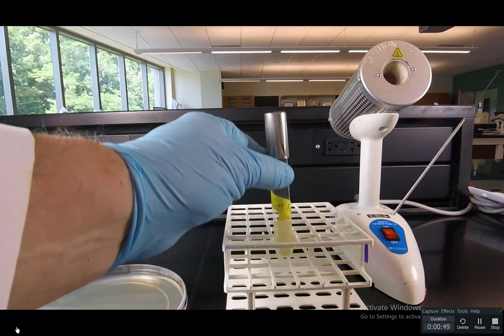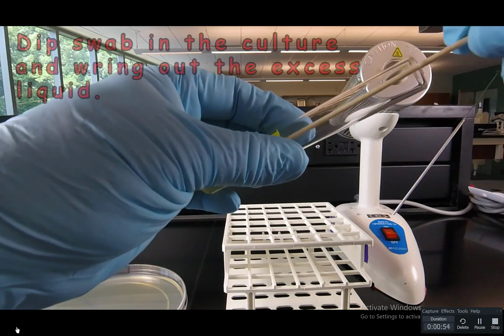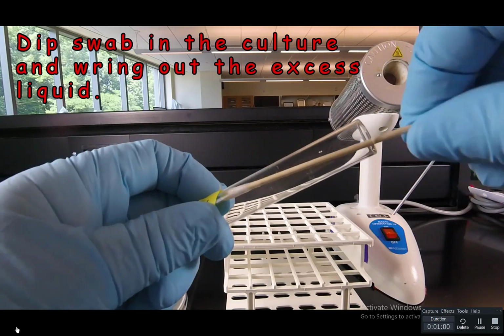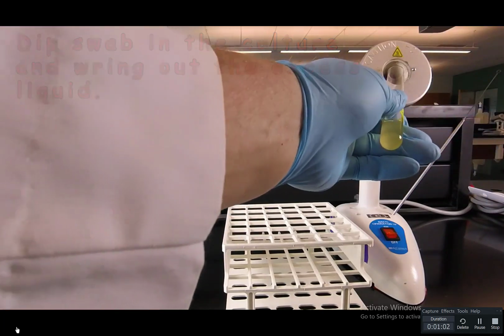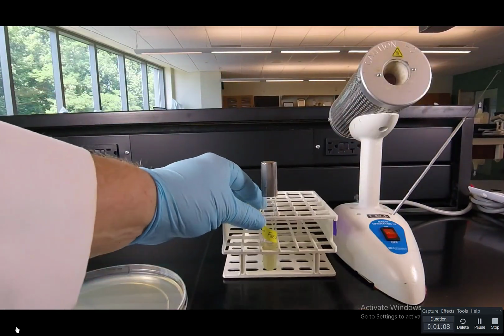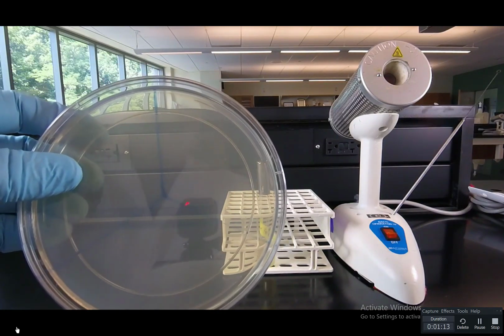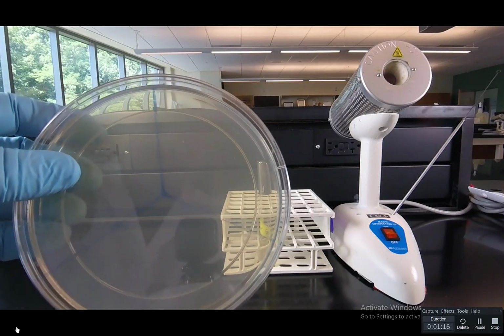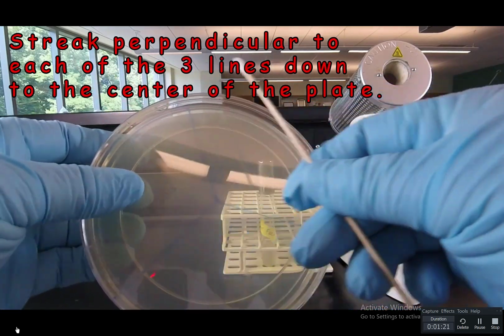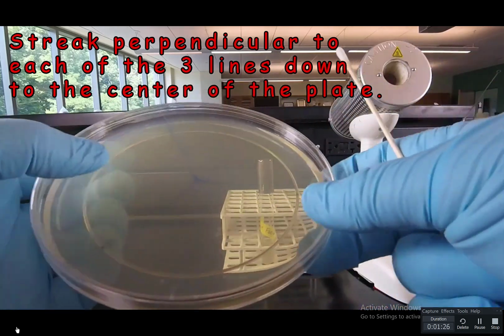We're going to remove the inoculum by flaming the tube, putting a swab in. Then we're going to wring the swab out against the inside of the tube to get rid of excess liquid. Flame the tube and replace the cap. Now we're ready to streak the plate. Now we divided our plates into thirds, as you'll see in the illustration in your lab manual to help guide our streaking. And we're going to streak perpendicular to each line, going all the way to the edge of the plate and overlapping the lines, working our way down to the center.